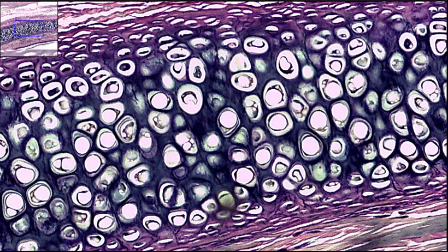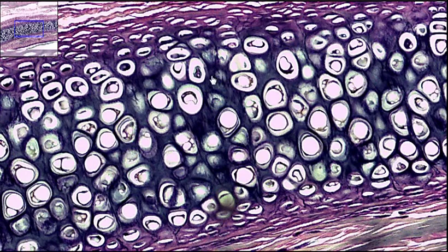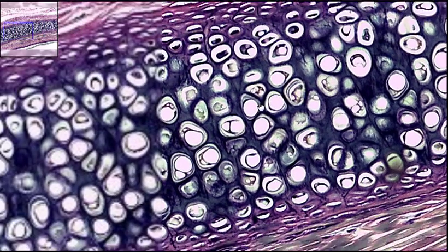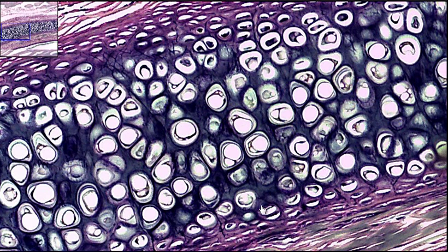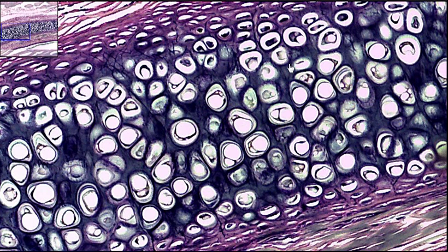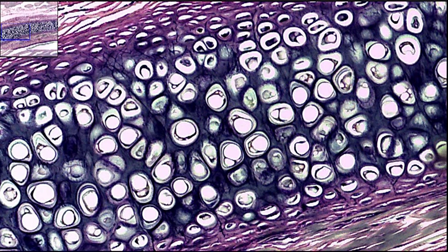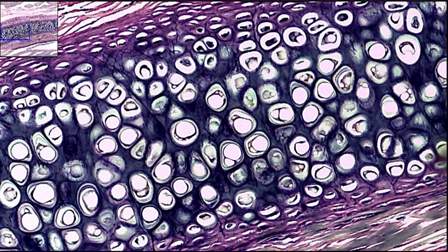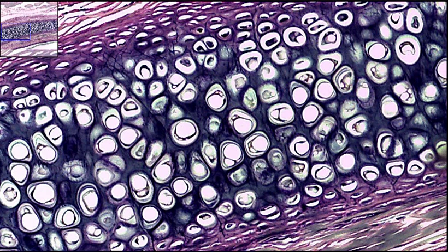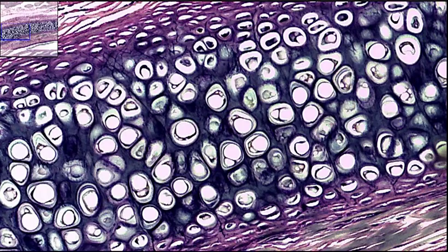And you can see the elastic fibers. Here's a fiber, for instance — you can see these fibers right here. If we move down a little bit, you can see all these fibers coming into the matrix. All these fibers coming through helps identify this as elastic cartilage. To identify elastic cartilage, you're looking for the elastic fibers. Seeing the fibers in the matrix is the giveaway for elastic cartilage.